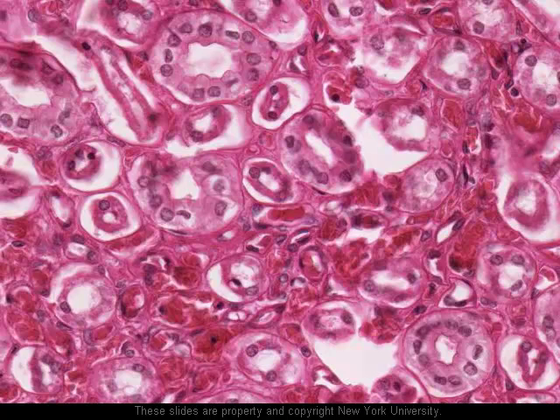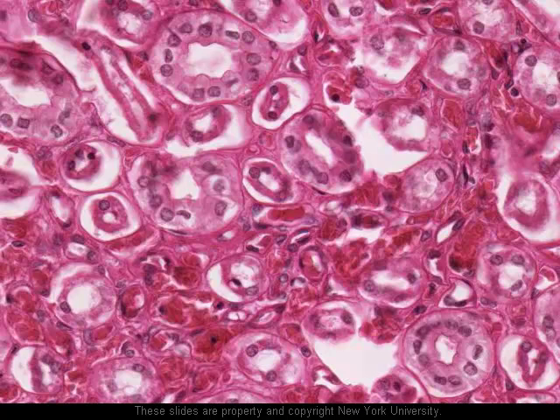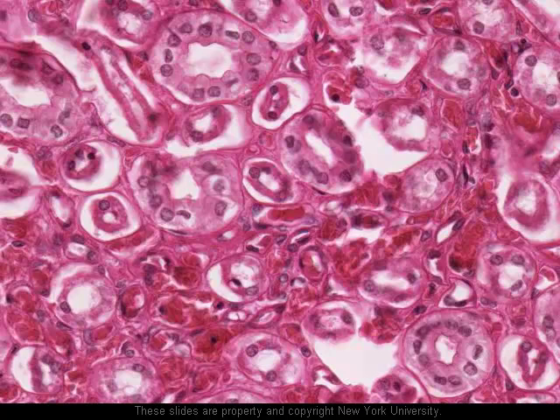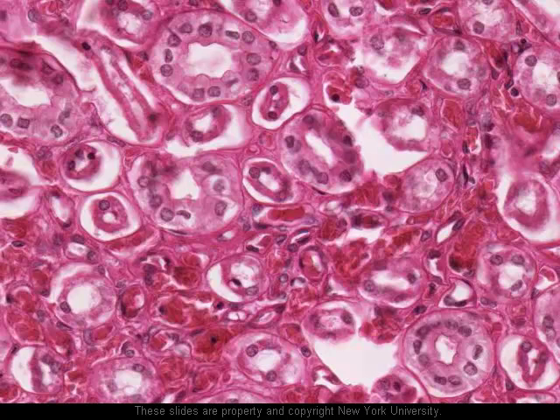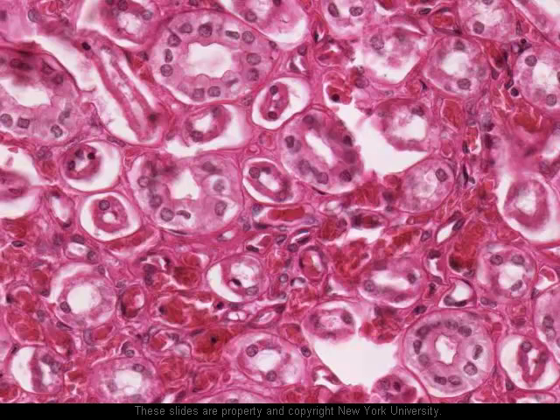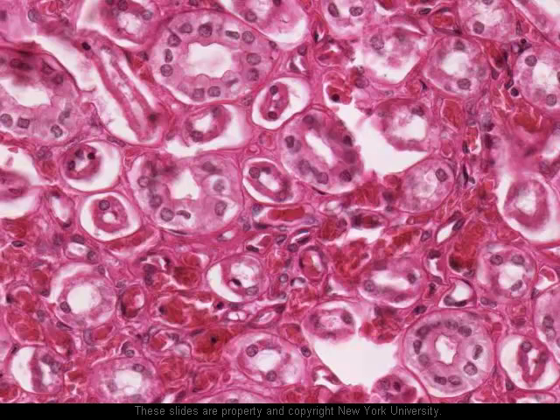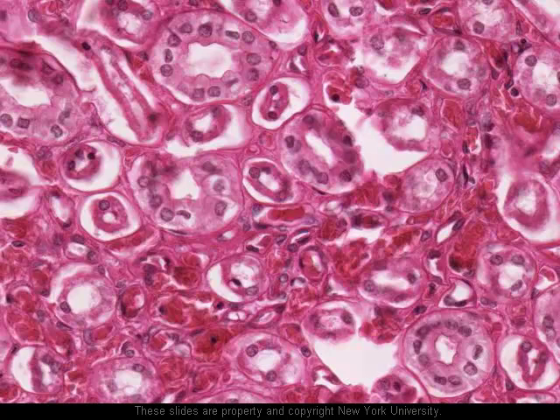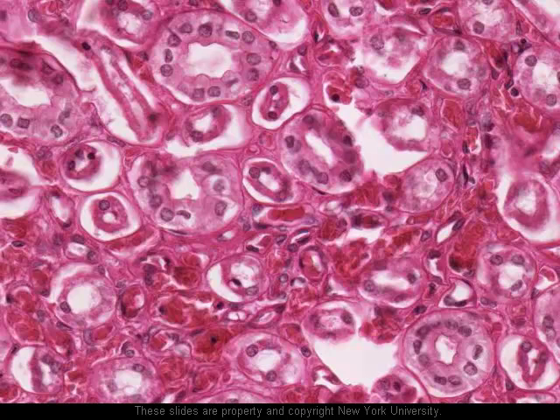Finally, although it's not easy to see the individual vessels — particularly the vasa recta, the straight blood vessels which parallel the loops of Henle — what we can see rather than the tubular structures themselves is the red congealed mass of red blood cells, erythrocytes. These represent erythrocytes contained within the capillaries of the capillary network, either that which surrounds the individual collecting ducts or in this region here surrounding the loops of Henle, and therefore are part of the vasa recta.